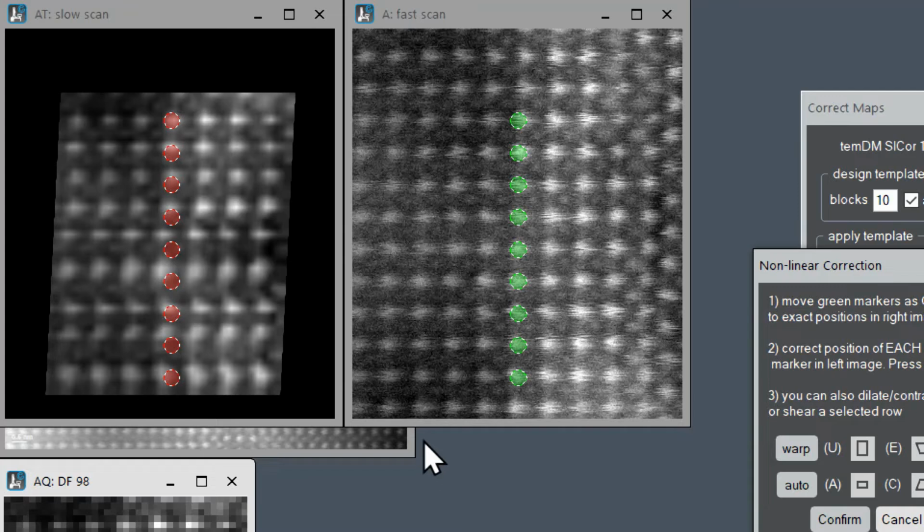Now we see a number of markers, green in the right image and red in the left image. And we have to position these markers at the right atomic centers. In this case, we start with green markers, and it's better to move these green markers as a group. Why as a group? Just because they are already spaced regularly. So moving them individually can only make the situation worse.